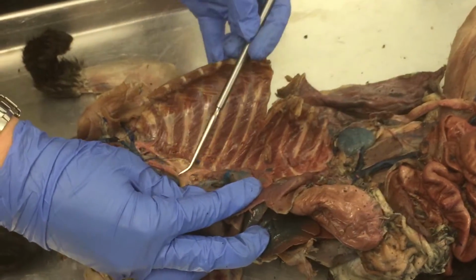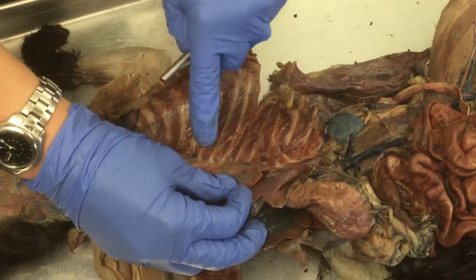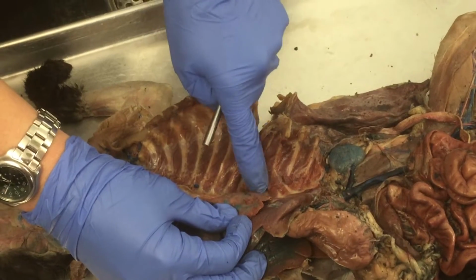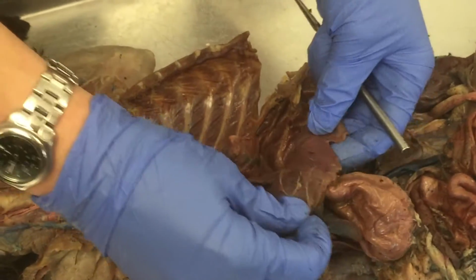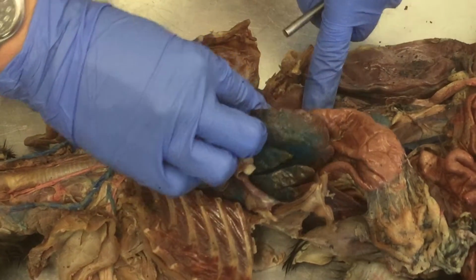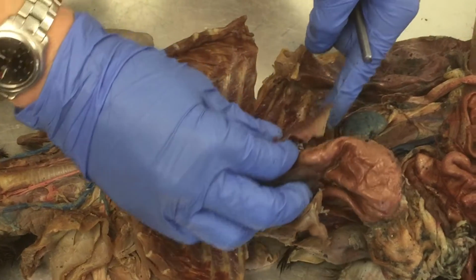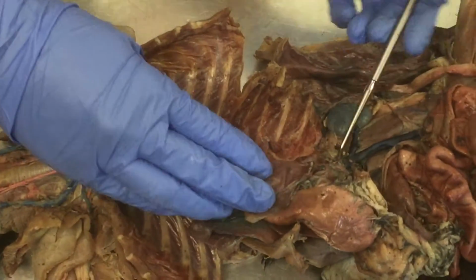So once you go to the left, then you're going to be able to ID your thoracic aorta. Okay, there's going to be some fascia covering it, so you may have to just pick off a little bit of fascia. And then, what muscle is this? Diaphragm. So diaphragm is probably still going to be attached to the back body wall here. You're going to have to skin it off of a bit of the posterior aspect of the thorax.